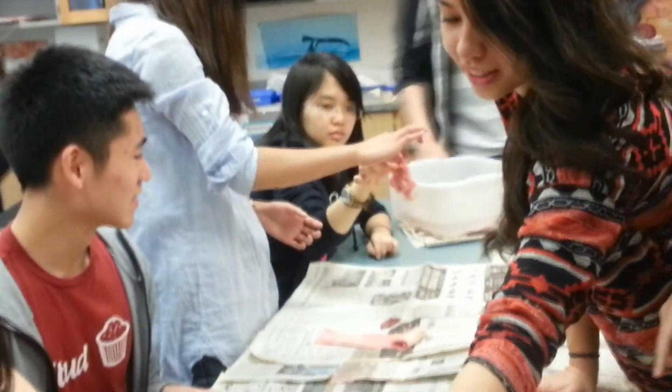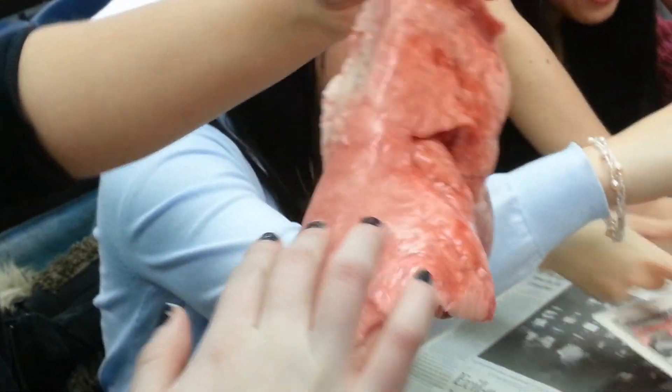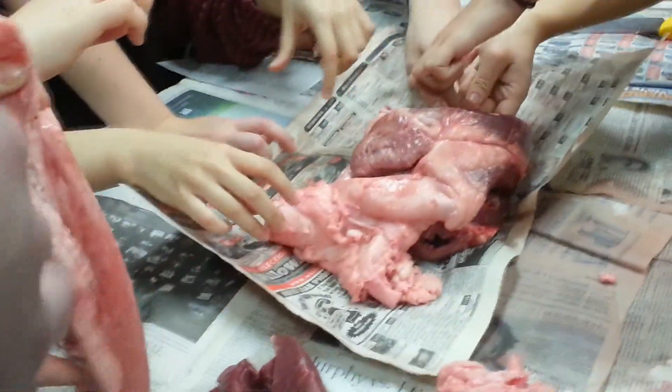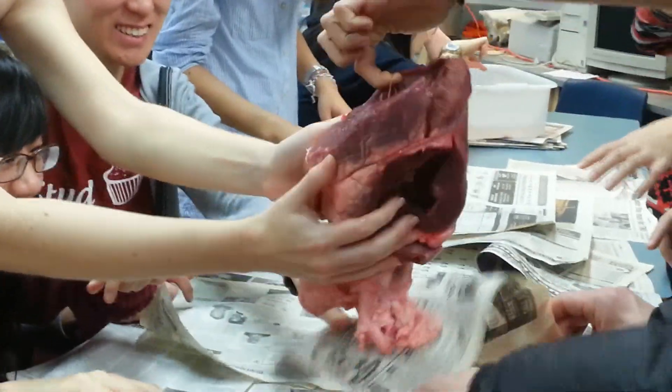No, touch this. Touch this. That was so creepy when it was blowing up. I'm gonna pull a heart exchange. Veronica was ripping them apart. I wanted to test my skill. Oh, hold it. Done. No, oh that's all. Thank you.